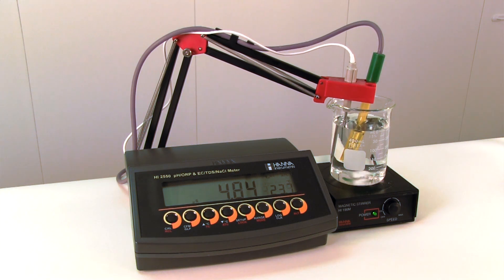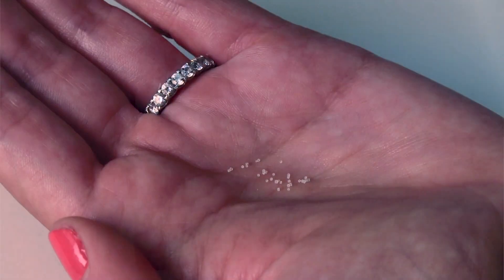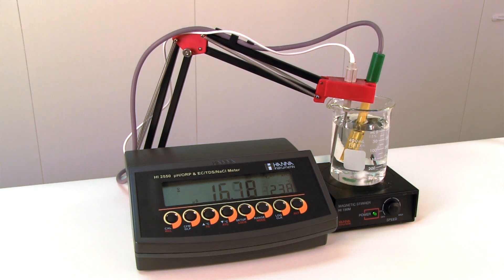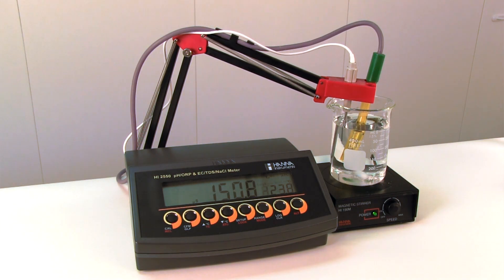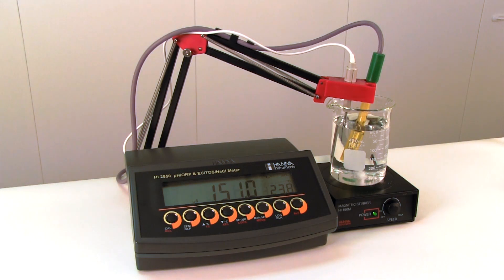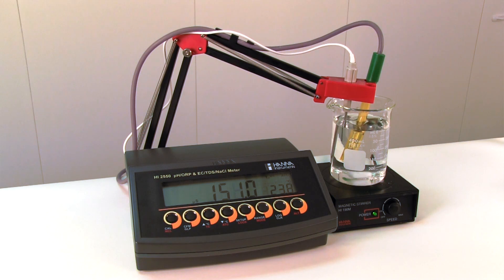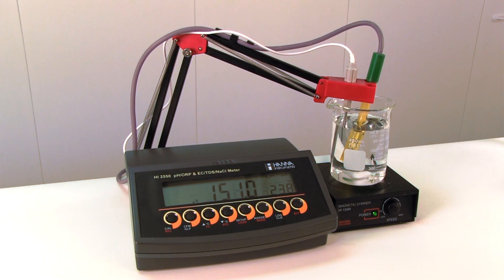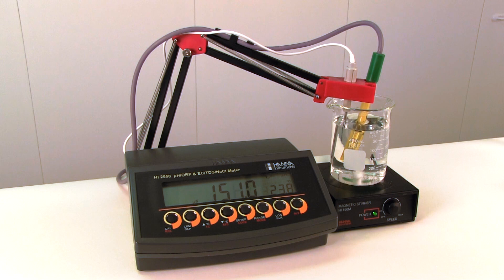Now, let's look at what adding salt does to our conductivity reading. I'm going to add just a pinch of salt to this 300 milliliter sample of water. Look at how much the conductivity increased — it went from 4.84 microsiemens per centimeter to 151.0 microsiemens per centimeter with just a pinch of salt added. That's just over a 3,000% increase.